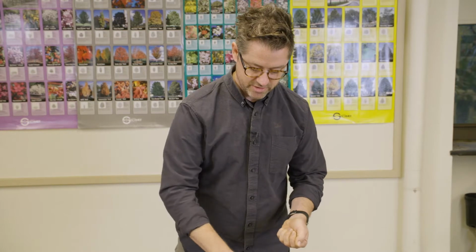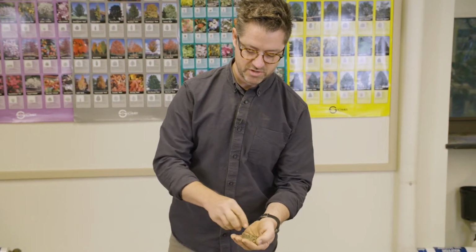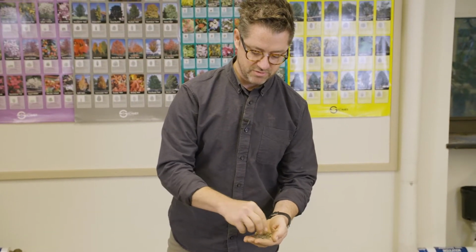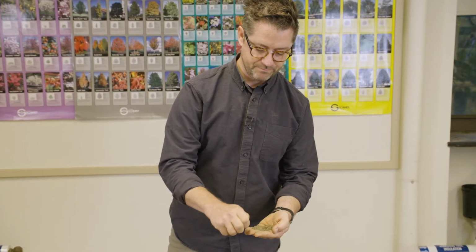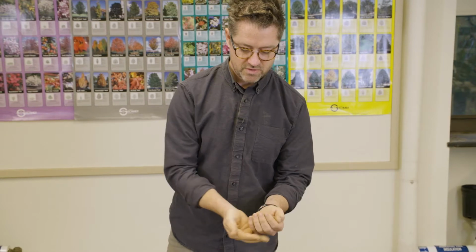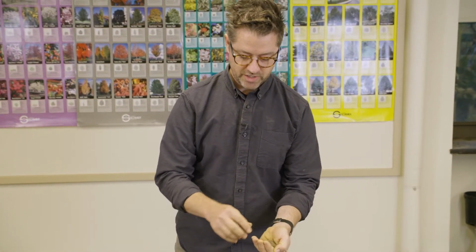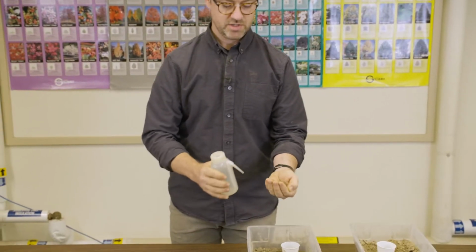I'm just going to get down to just the basic composition of the soil here. Again, I'm just kind of sieving them out, filtering them out. Okay. Last pieces of gravel here. All right, once I have what is pretty much just the soil left, these are just field soils, just dug.